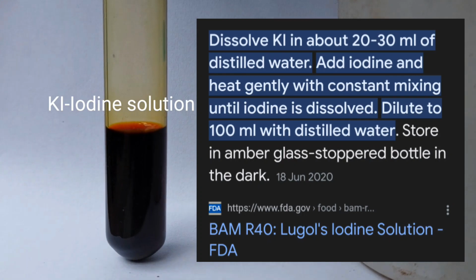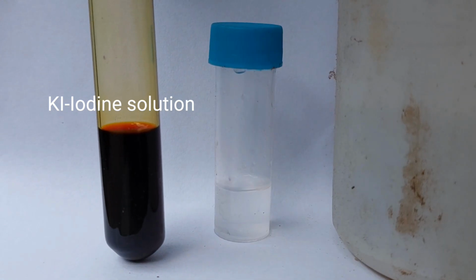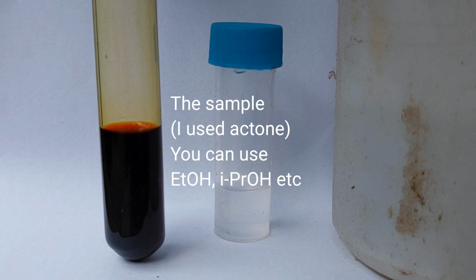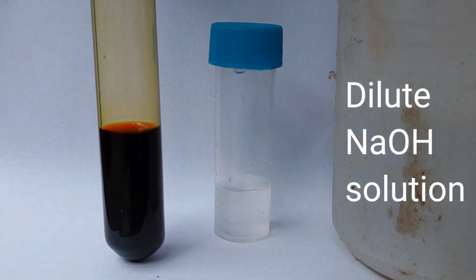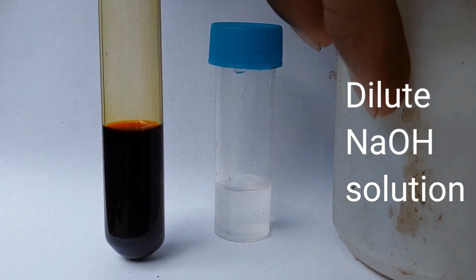I will provide the measurements, and this is done because the solubility of elemental iodine in distilled water is very low. And we'll also need the sample. I am using acetone, you can use anything else. And this large thing, this is a dilute NaOH solution.